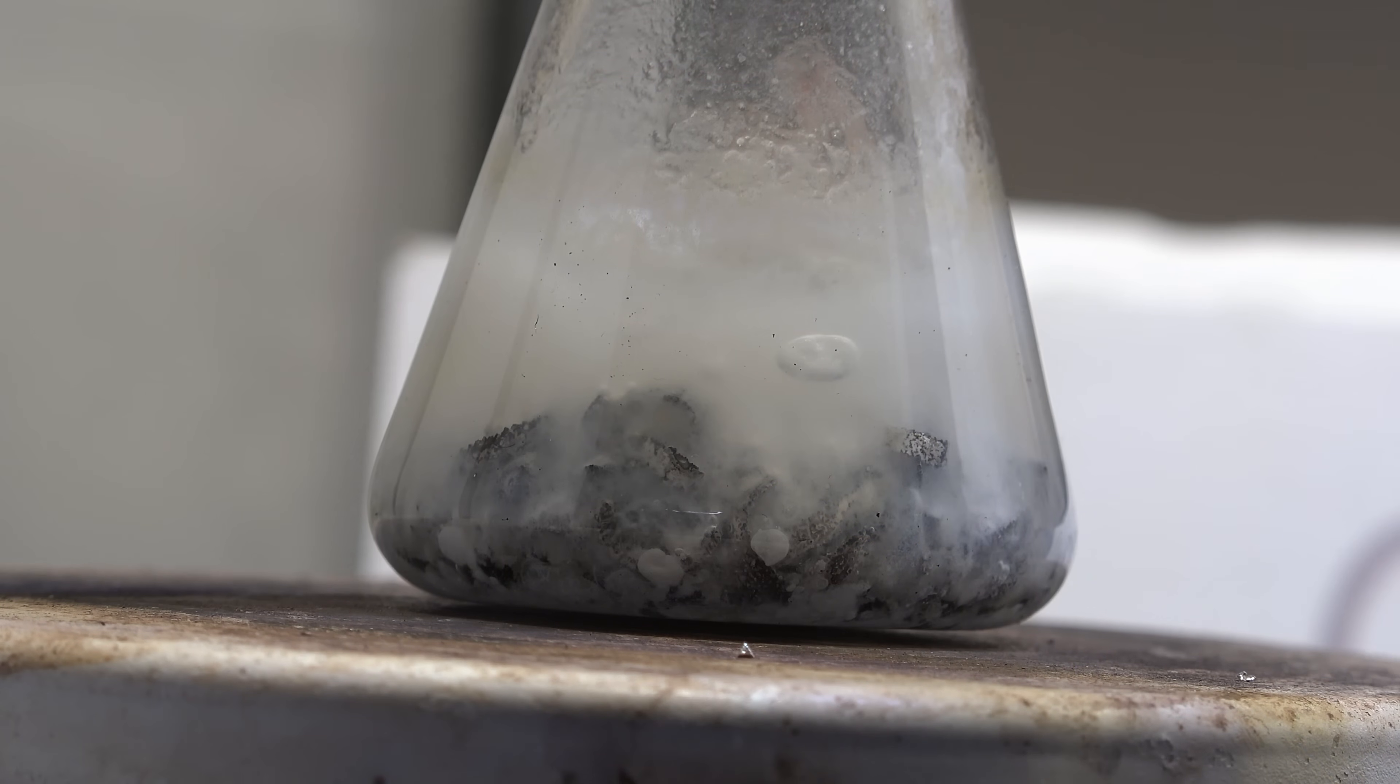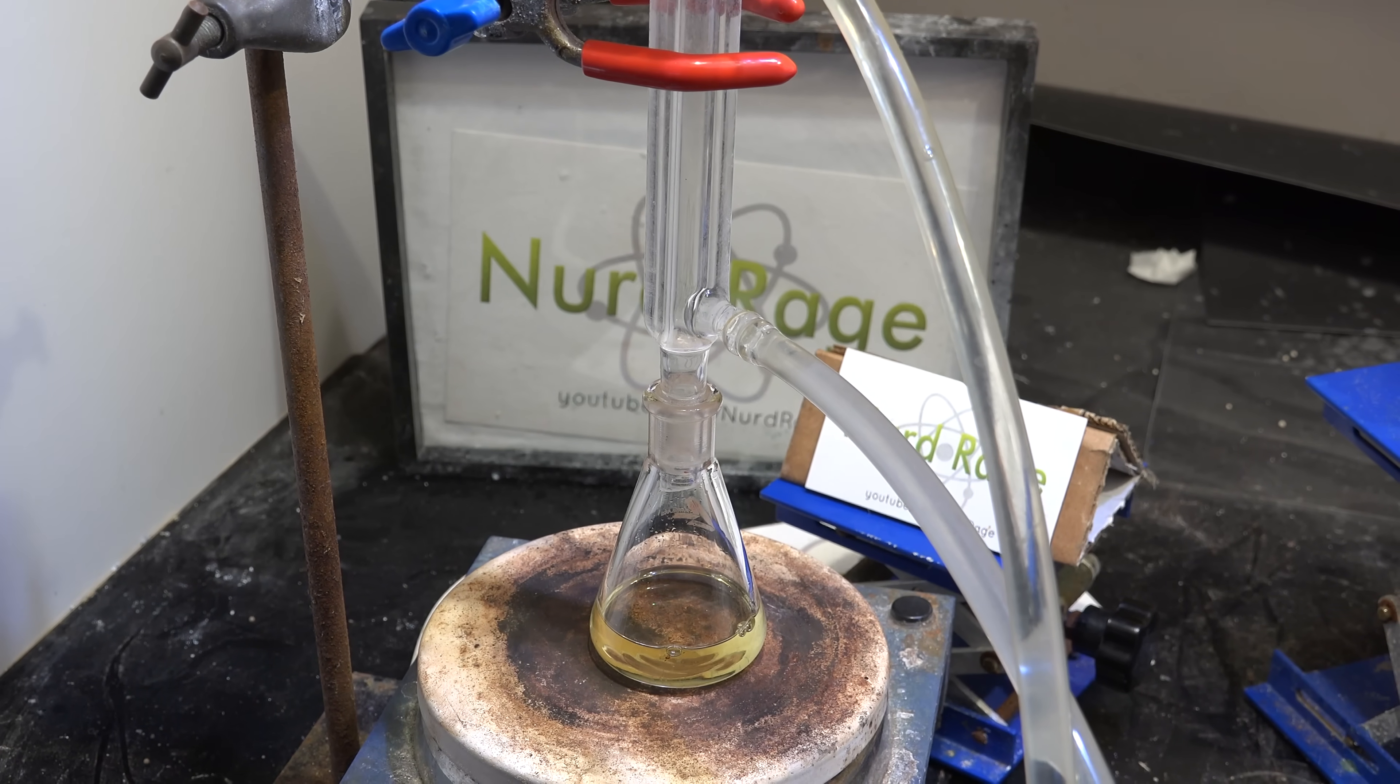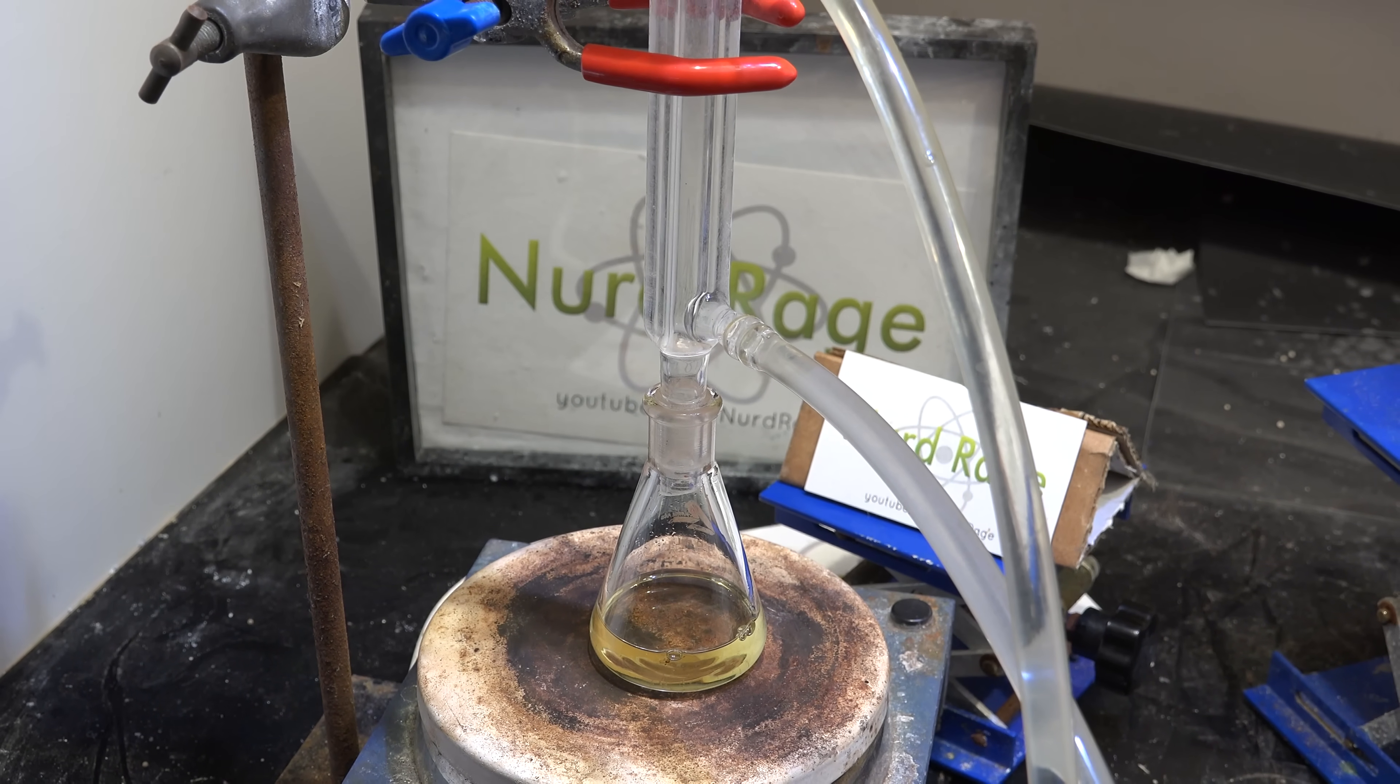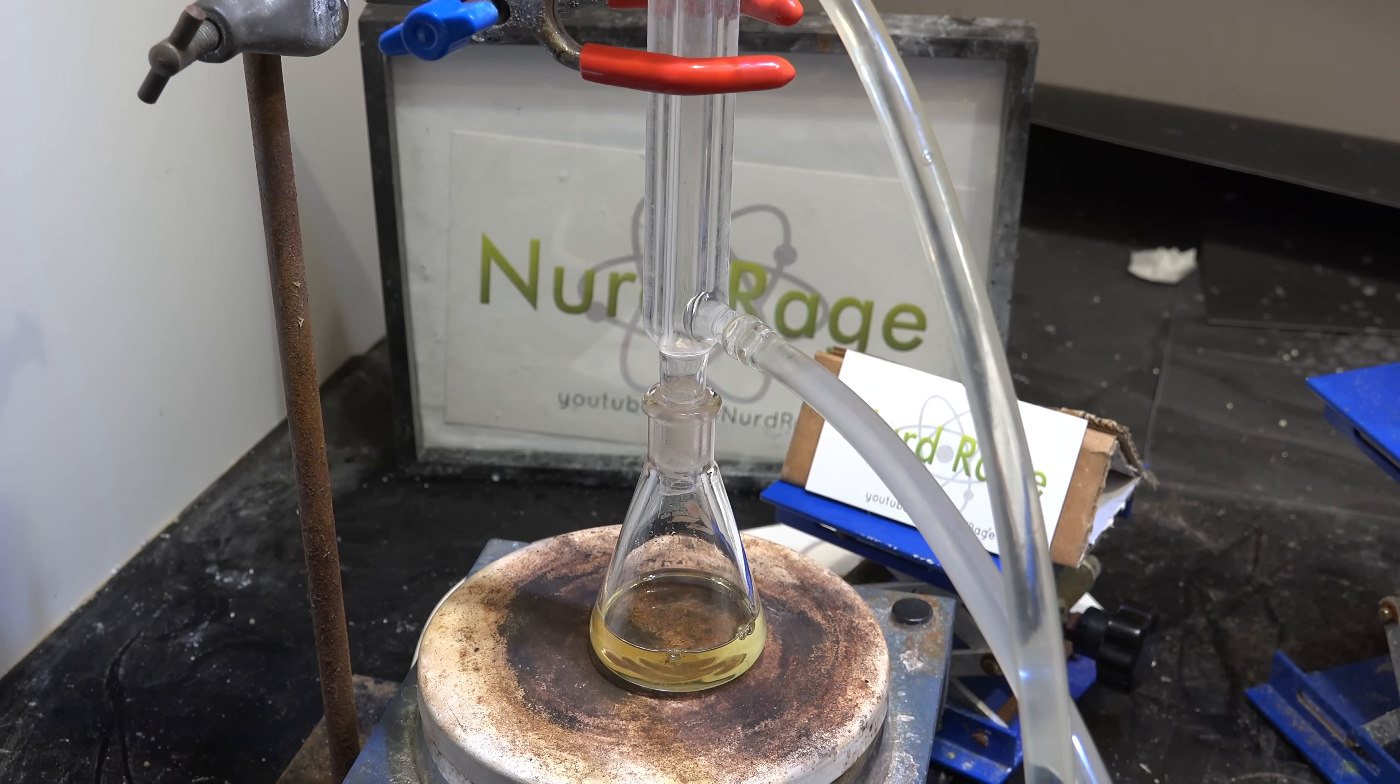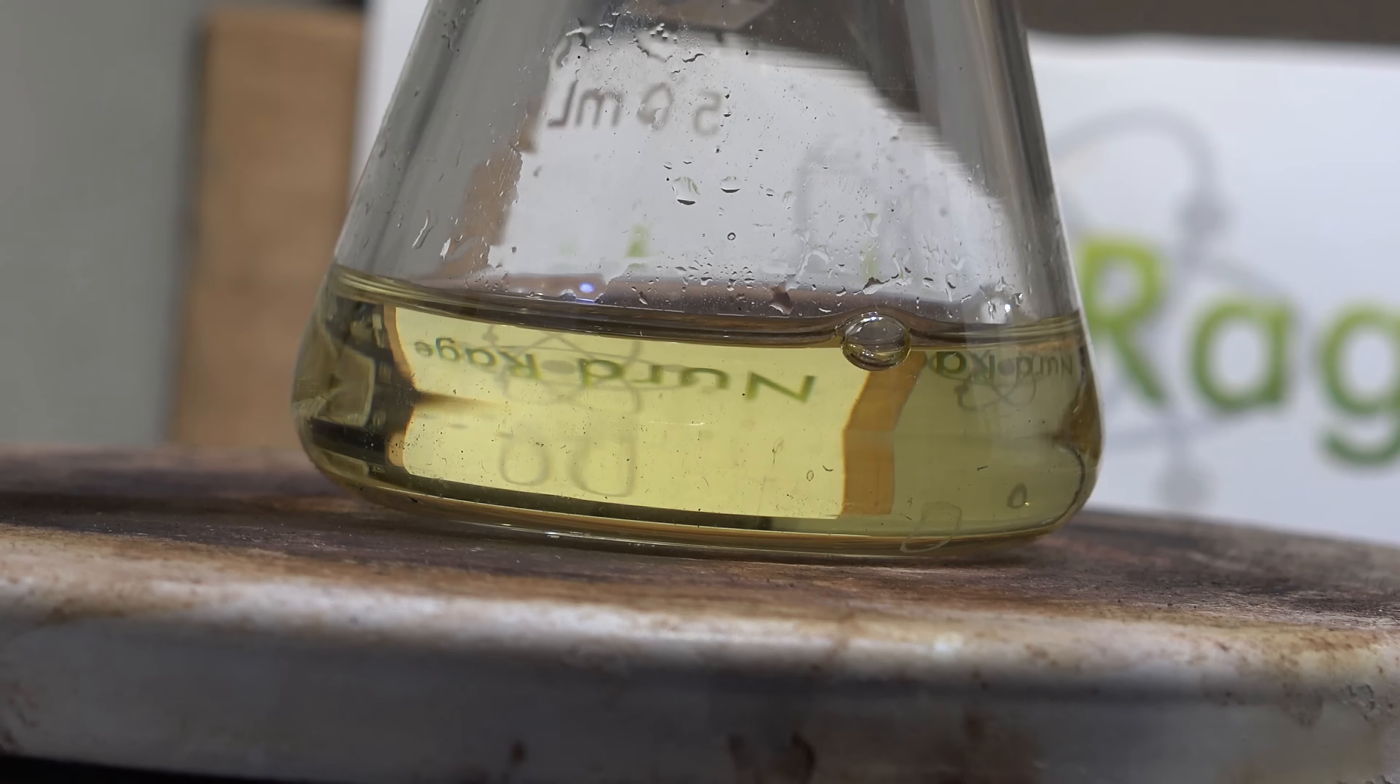Lighter alcohols cannot be used as the solvent because their alkoxides are solid even at these temperatures. But 7-hexyl-7-tridecanol alkoxide should still be fluid even without dissolving in another solvent. Now the alcohol is yellow due to some minor impurities but still the majority component.